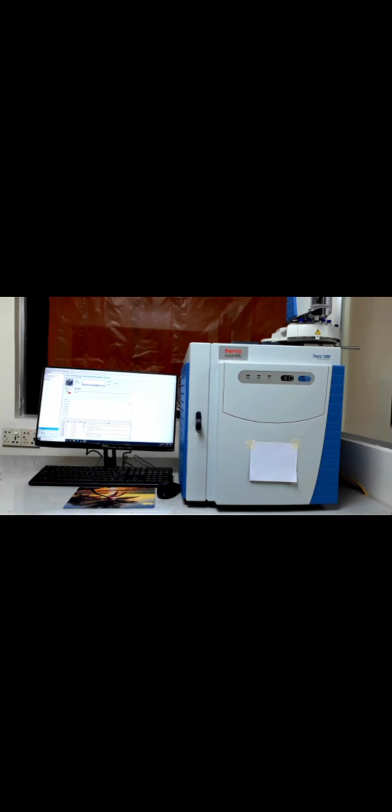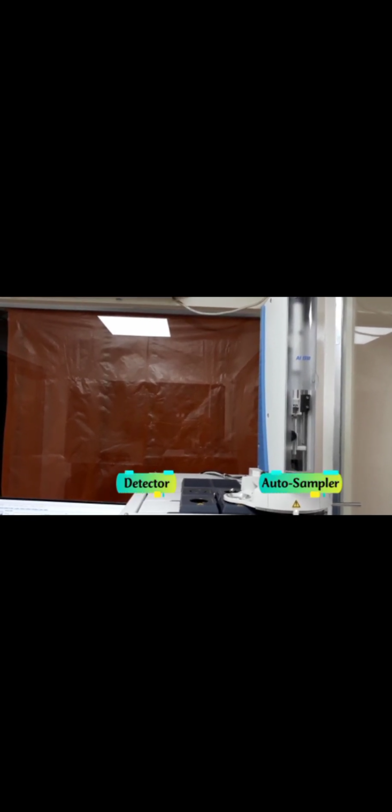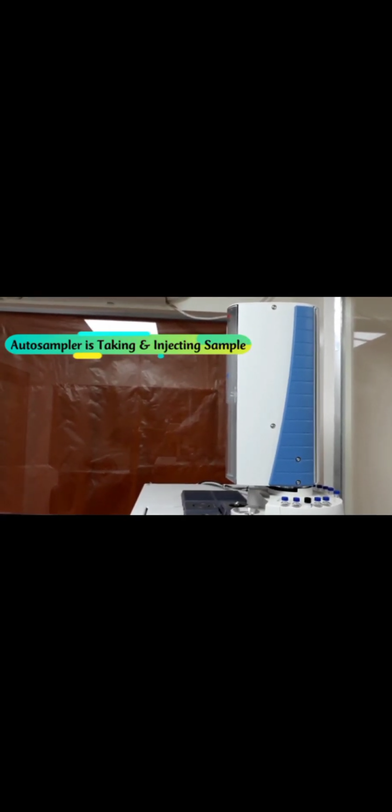Gas chromatography. A gas chromatography is an instrument which can be incorporated into GC-FID or GC-ECD or GC-MS or GC-MS/MS. But the major ones in most laboratories are GC-FID and GC-MS.